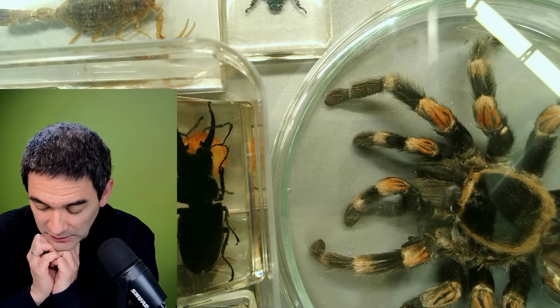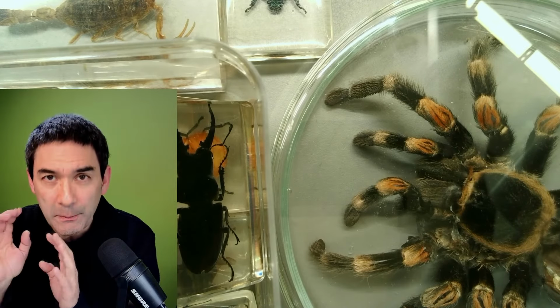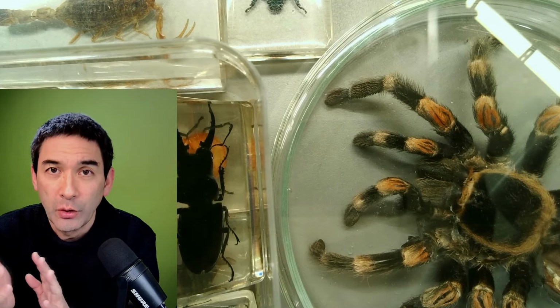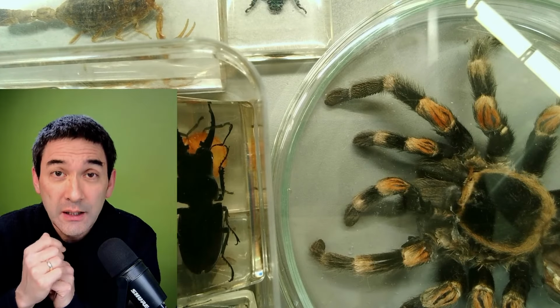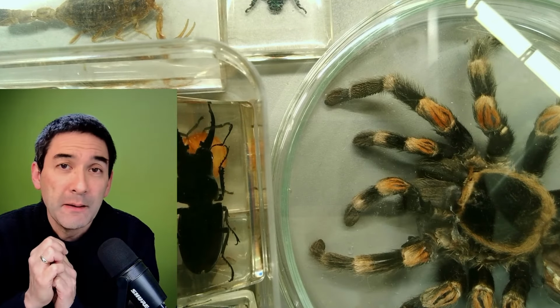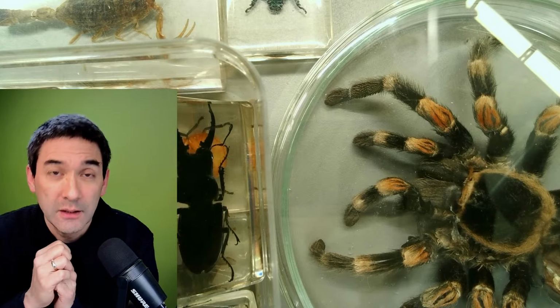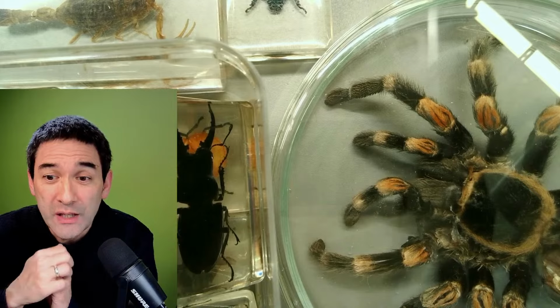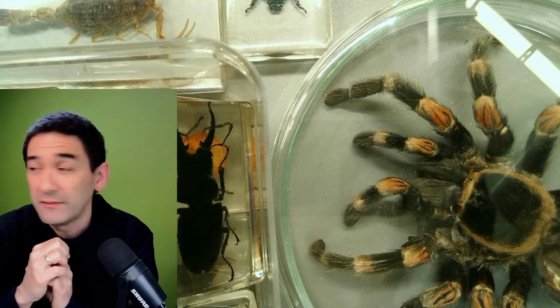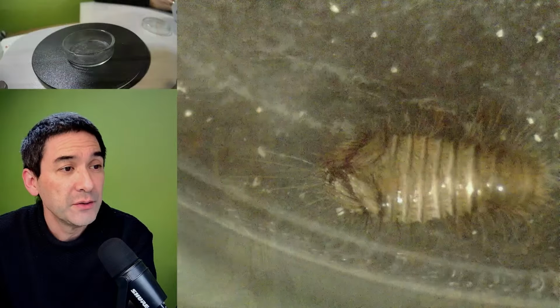So what are we going to do today? First of all, I'm going to pick up where I left off in a video that I made just a few days ago. Maybe some of you have seen it. I've made a video of a so-called carpet beetle. You can find that video on this channel. I just want to show you the carpet beetle that I found under the microscope.